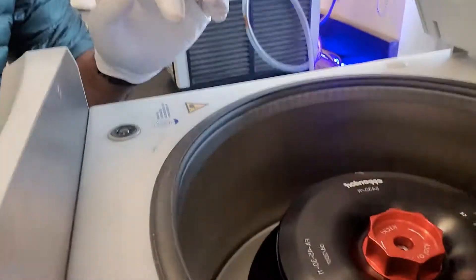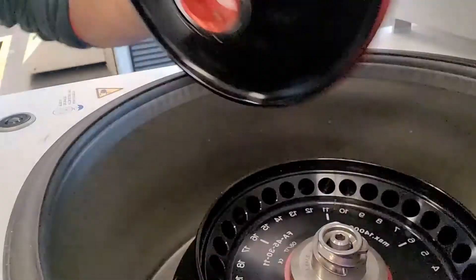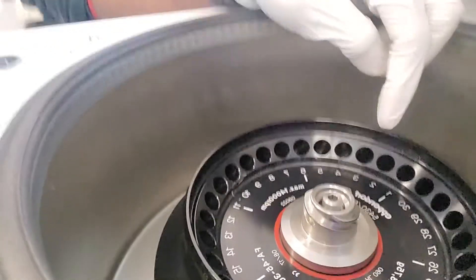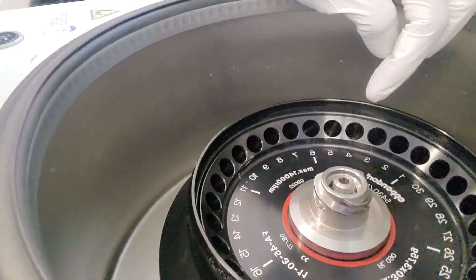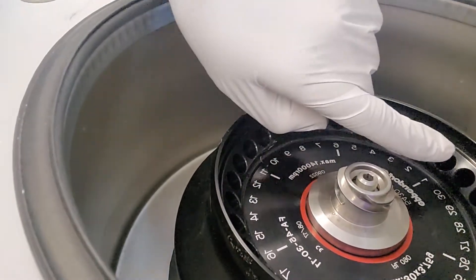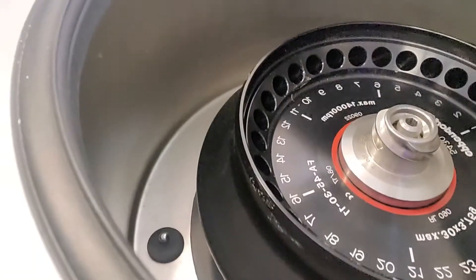I have just unspun this, so the top is going to come off. You'll notice that everything is numbered here and there are some white lines — that's going to be super important. The centrifuge always needs to be balanced. It generates several thousand times the force of gravity. Imagine several thousand times the force of gravity pushing on one tube going that way — bad things are going to happen.